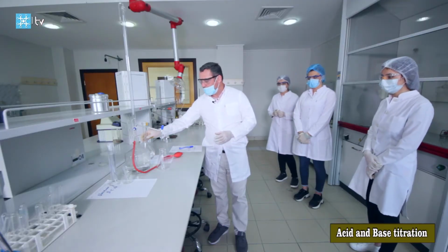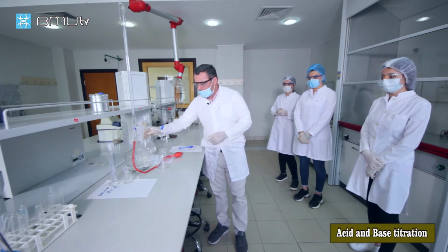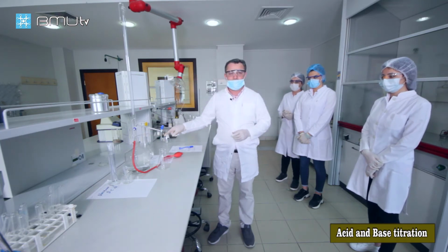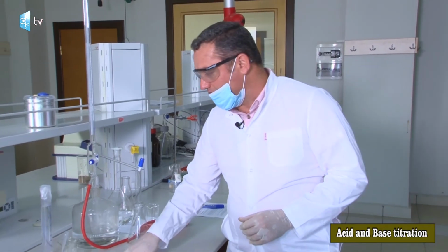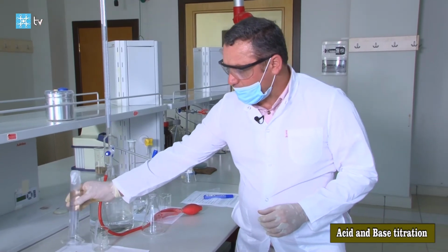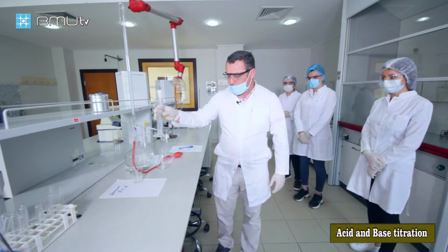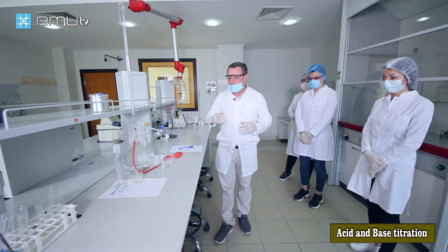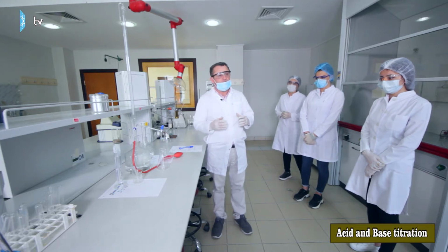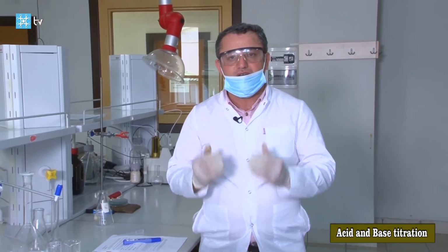Our instructor made the solution. This is a basic solution, sodium hydroxide solution, and we know the concentration of this solution. Also, our instructor made the acidic solution, an unknown monoprotic acidic solution. And also, we need to observe whether the reaction is complete or not. That's why we must add the indicator.